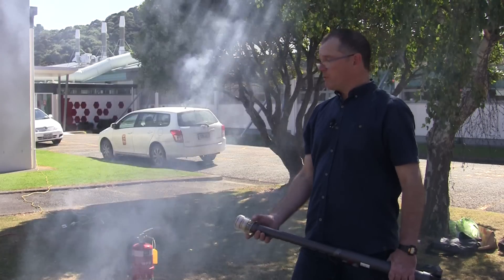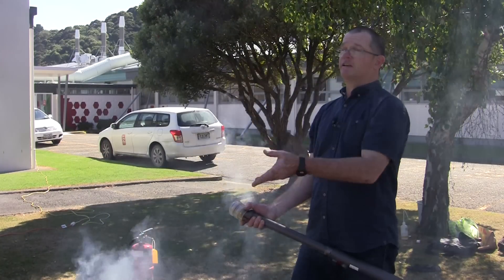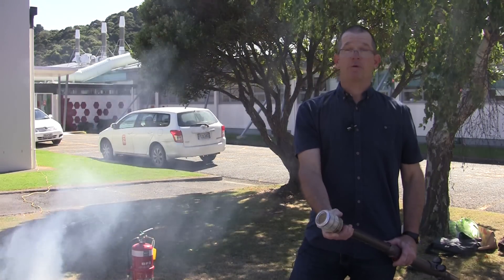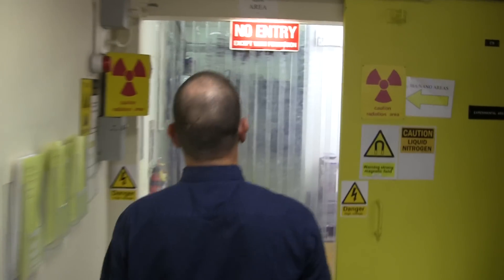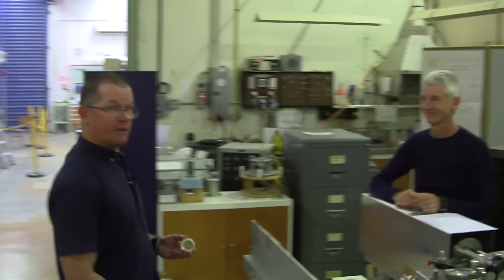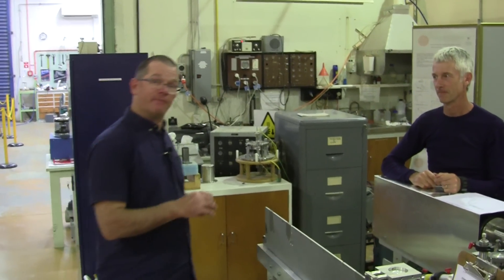So now we've got our three samples: fresh air, motor vehicle, and our wood smoke. Now I'm going to show you what we do next. I'm going to analyse them using our instrumentation. My colleague Bill is going to tell you exactly how we go about doing that.